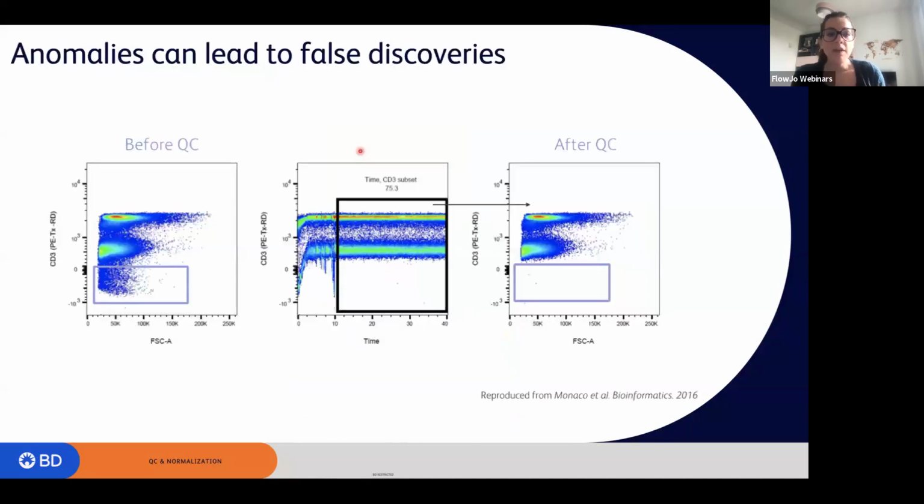So if you look at this example right here, what we see is that for our CD3, for example, if we do not perform QC, we may think that there is an extra population right here at the bottom left corner. But when we plot CD3 versus time, which is actually a general control that we do, right? We want to check the signal stability over time for each parameter. We see that there was a problem at the beginning of the acquisition right here. So what we would normally do would be plotting each parameter versus time and then make sure that everything is fine. In this case, it looks like something was not fine.